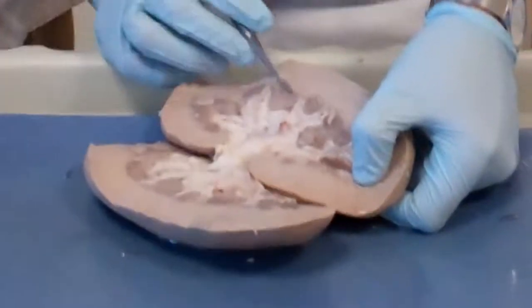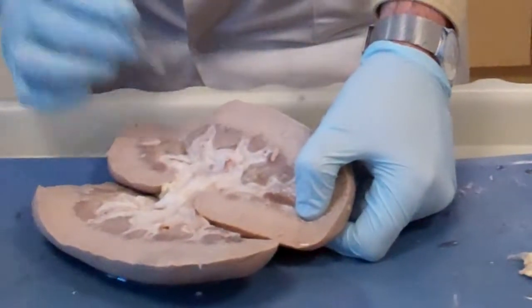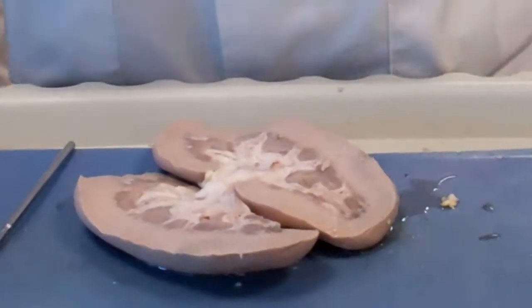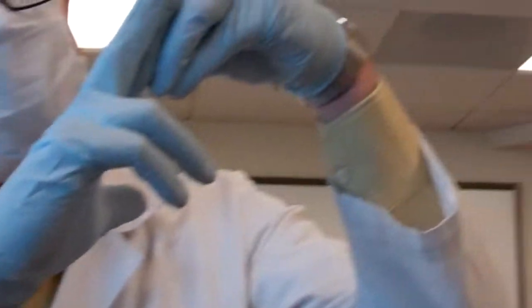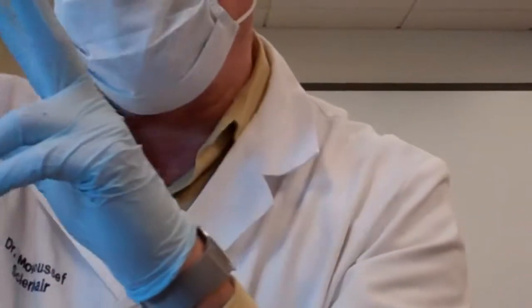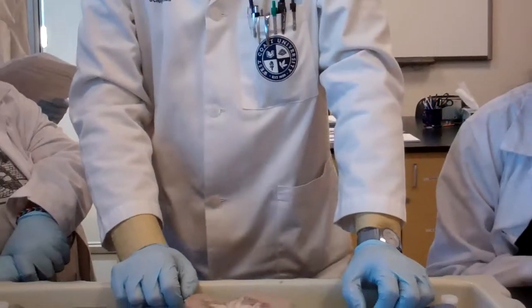It's not in one level only, one plane only. It's 3D. So technically, the calyces go like this on both sides. There's the calyx here and the pyramid here, and the calyx here and the pyramid here, all over. It's like a globe, but a little flattened. Wherever you cut here, you will see the medulla and the same arrangement, but you'll see only two dimensions.